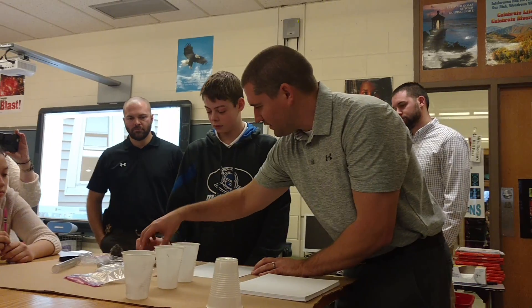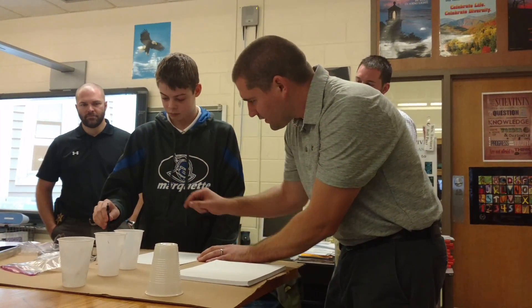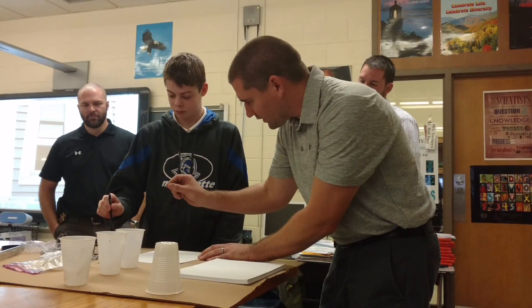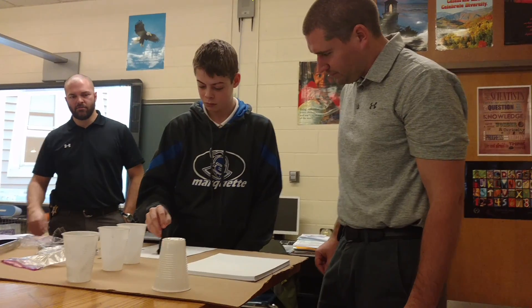So we'll start with the magnetic powder here. Go ahead and just hold it from there and dip it down in there. Then kind of give it a little shake just to make sure. And now just take it and start swirling it around the paper and see if you can get anything to show up on there. It's kind of like you're painting.